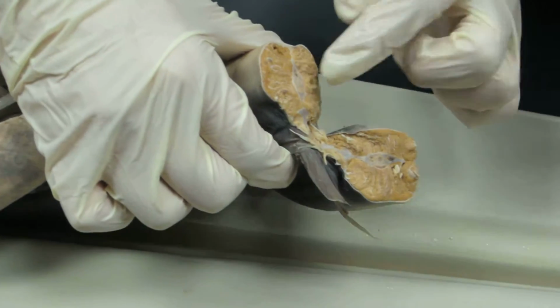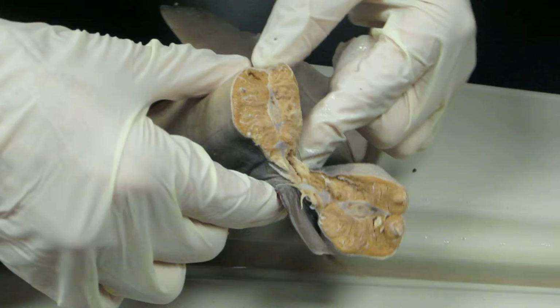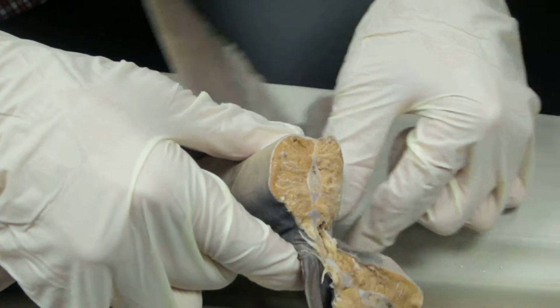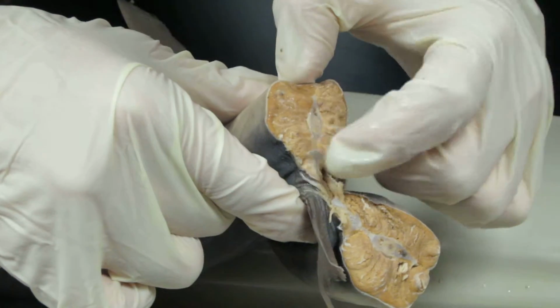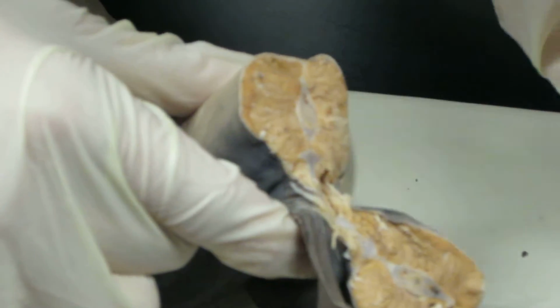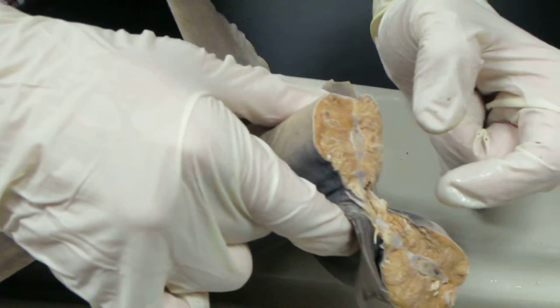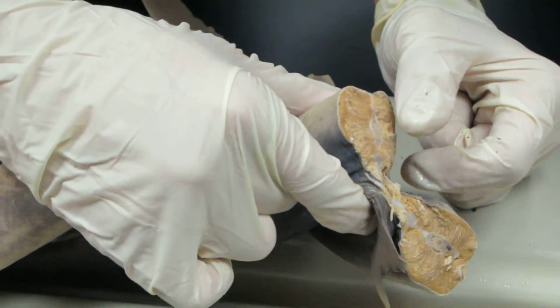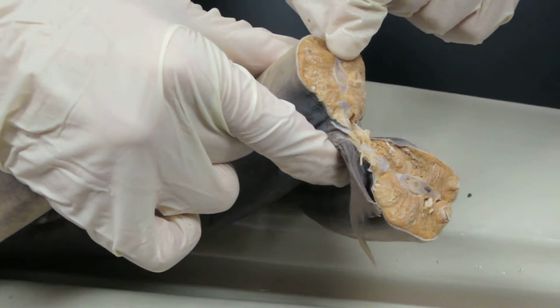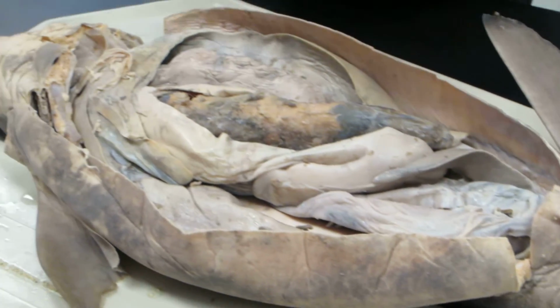So this is the dorsal area, right? Dorsal. So what were your descriptions for the notochord? It's hollow. This one right here is part of your notochord. The inside's kind of mushy if you want to touch it. Okay. Yeah. The nerve cord runs through here. See how there's a little hollow right here? Okay.